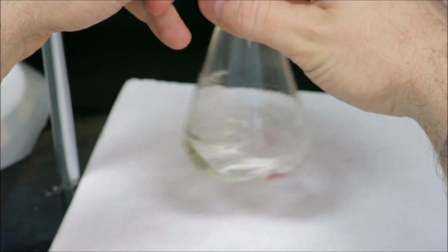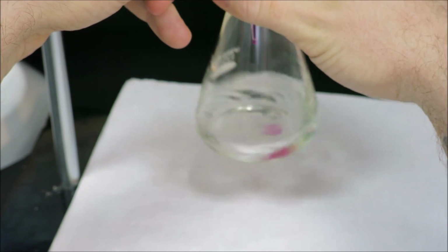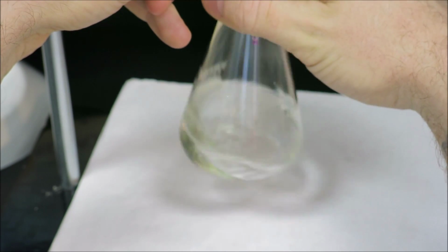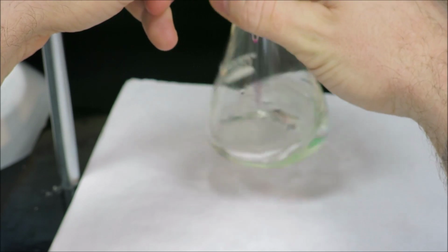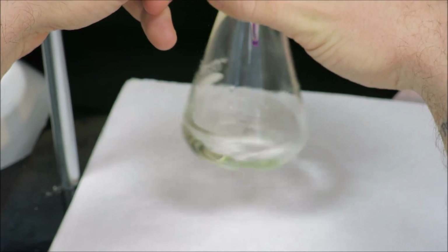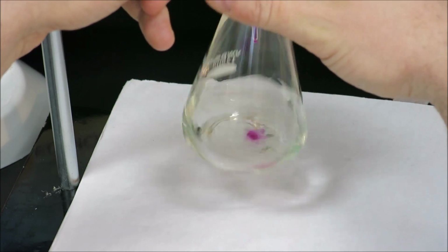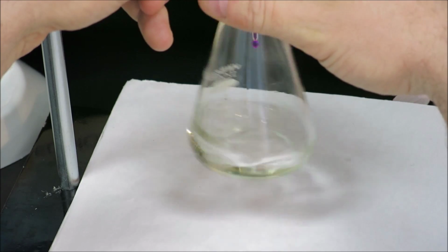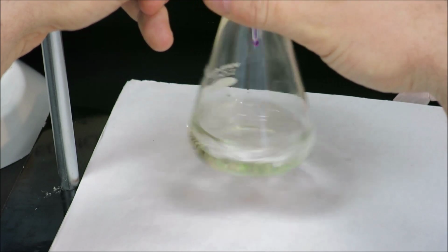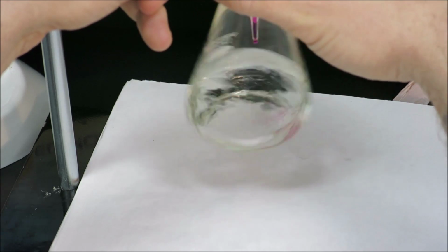You cannot use water when doing a pH titration because water will dilute. And once you dilute, the concentration of hydronium ions will be lower, and that effectively changes the pH. However, in a redox titration, the moles of the sample are set once I measured out my 10 milliliters, and adding water will not change the number of moles that are reacting.